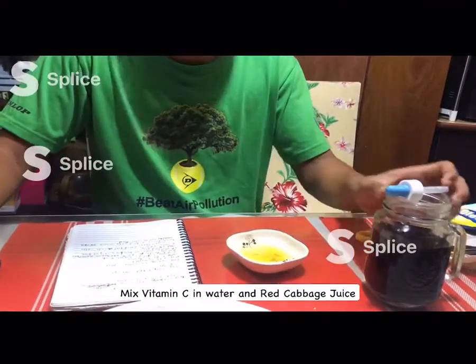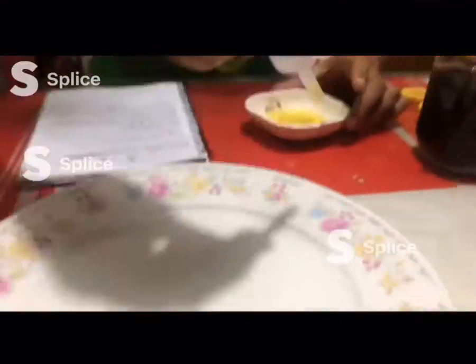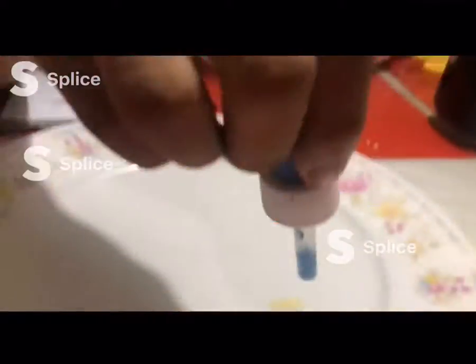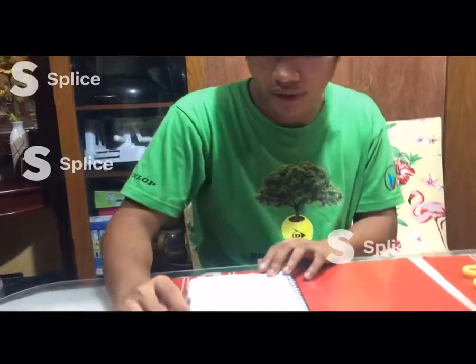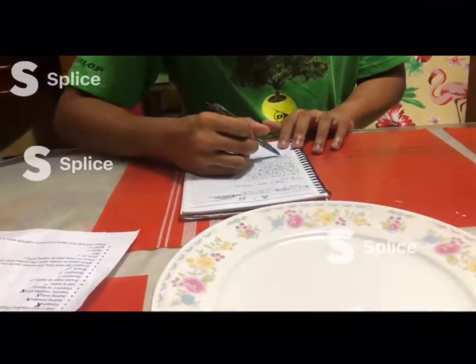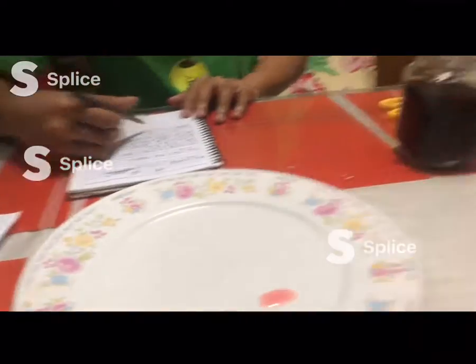So next, I will mix vitamin C in water and the red cabbage juice. I notice when I mix them, it turns pink.